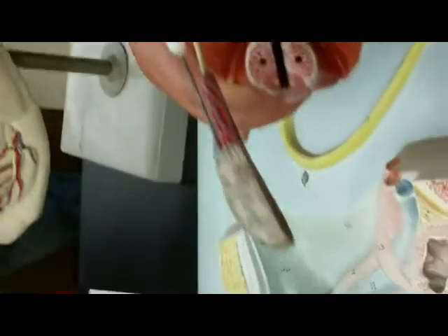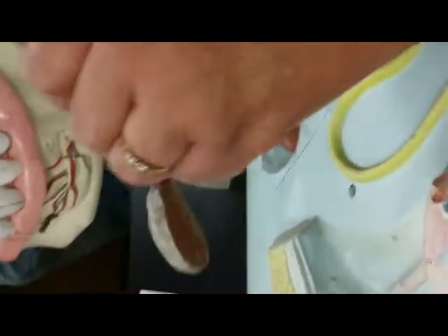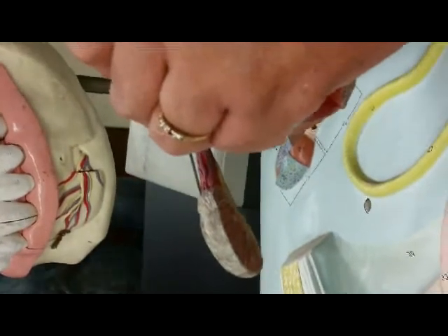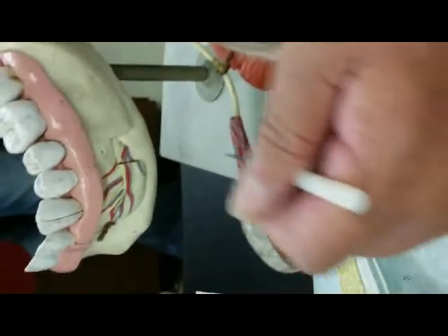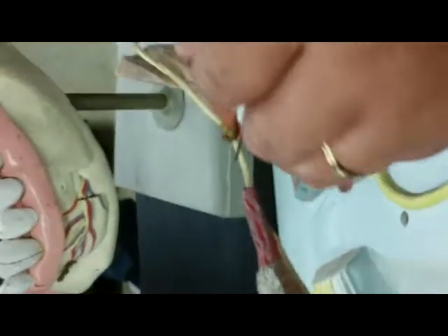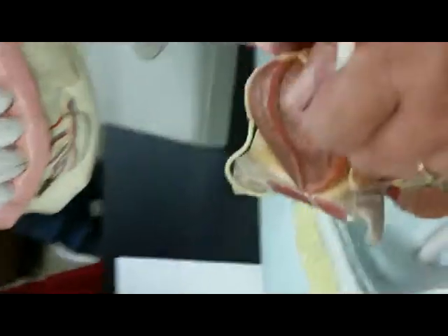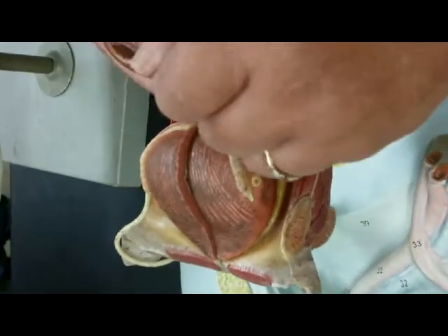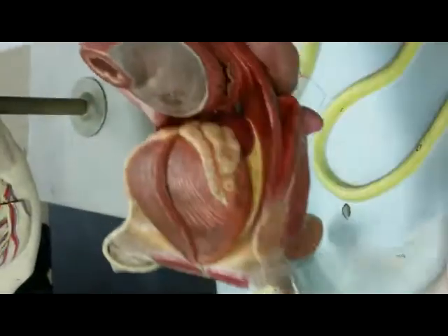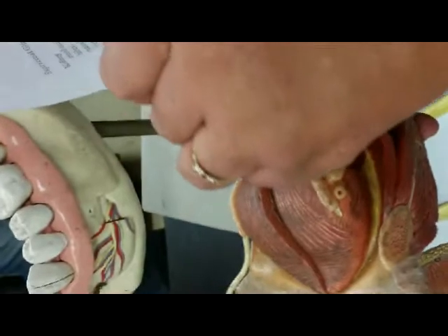What is this on top of the testis? No, you have already taken off the scrotum. So you're seeing the testis, and this would be what? Epididymis. And this spermatic cord includes the testicular artery, testicular vein, and this, what is this? Vas deferens. Okay. And now, what would this be? Same thing as we saw on the other model. What is it? Urinary bladder. And what is this? Prostate gland. Same thing like over there. What is it? Seminal vesicle.